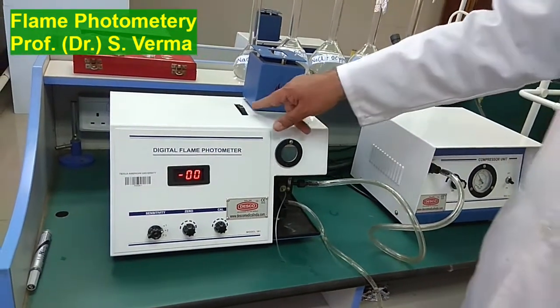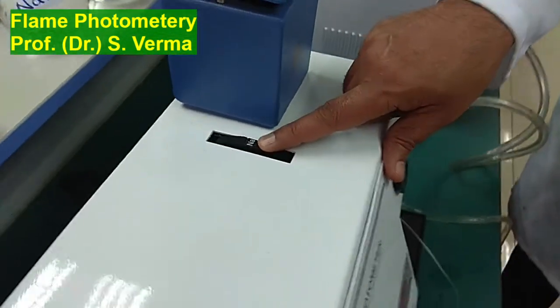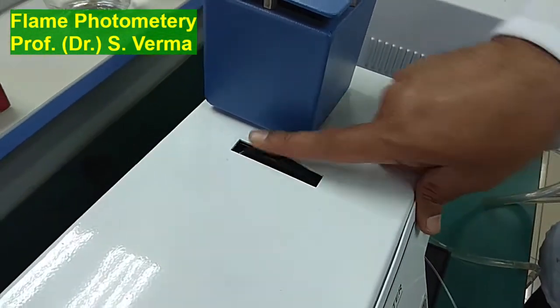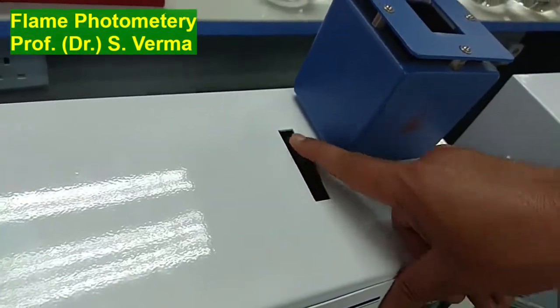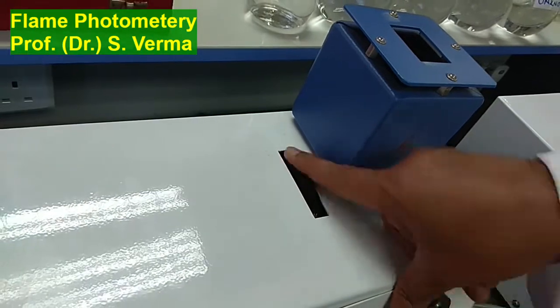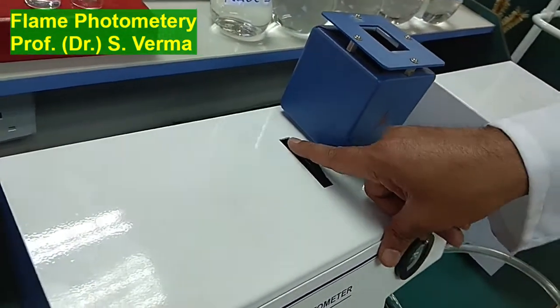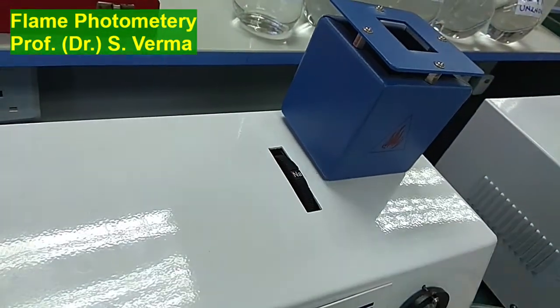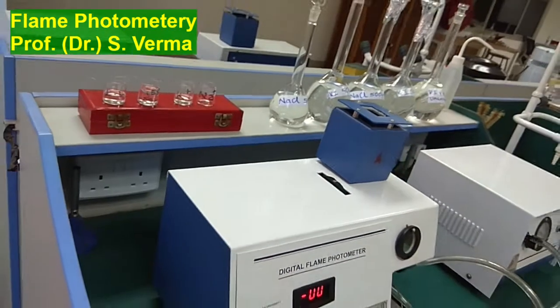Okay, then we have this filter here. When you are to find sodium, you will keep it at sodium. If you have to find potassium, you bring it to potassium, because if it is at potassium, the filter will only allow the potassium wave to pass through. And if it is on sodium, it will allow only sodium to pass through. So that is the role of the filter.